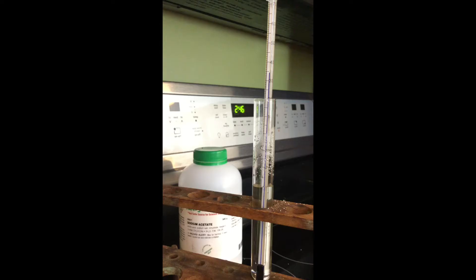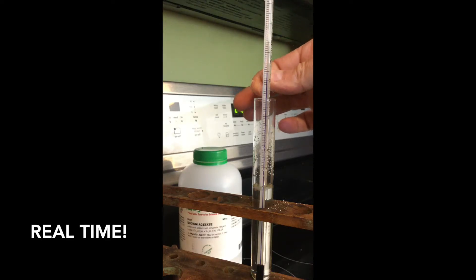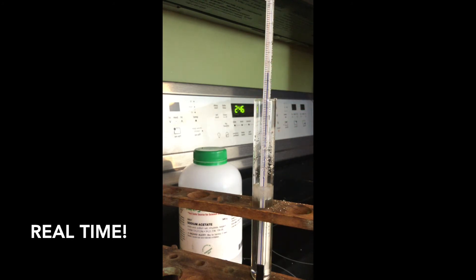Also, take note that the starting temperature right now is at about 35 degrees. Now, as I start to sprinkle, keep an eye on the temperature and the... Whoa. You see it? It's crystallizing. Like legit. Look at it. It's moving down, down the test tube. Thermometer up. Still 35. Still 35. Still 35. Crystals are moving towards the bottom. And they've reached the bottom.